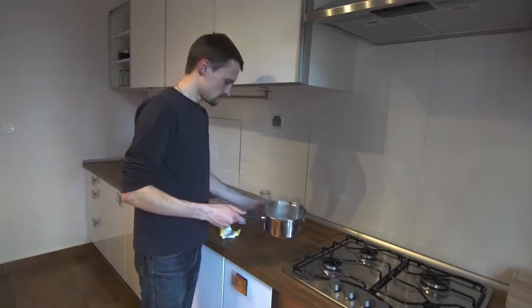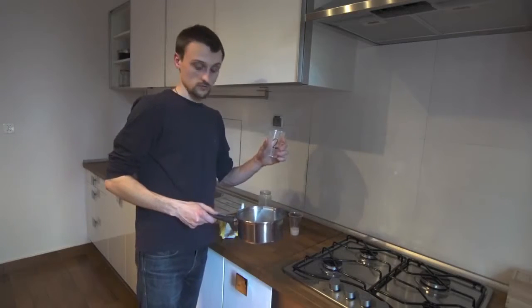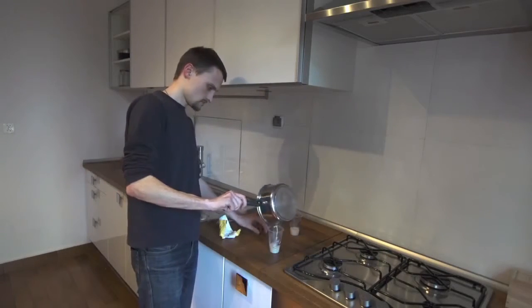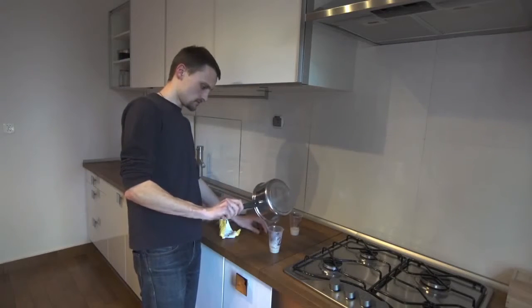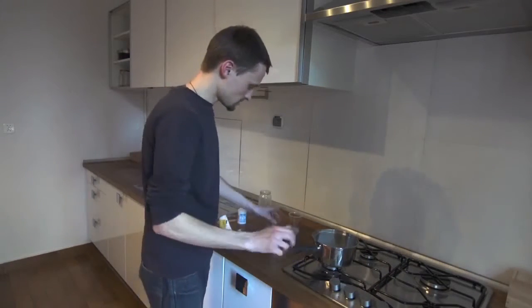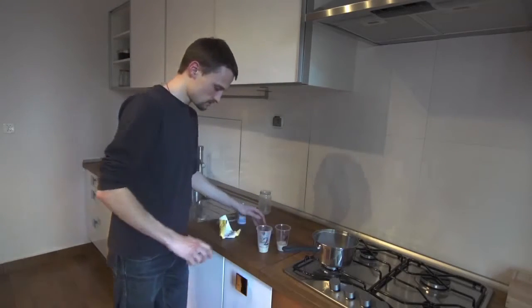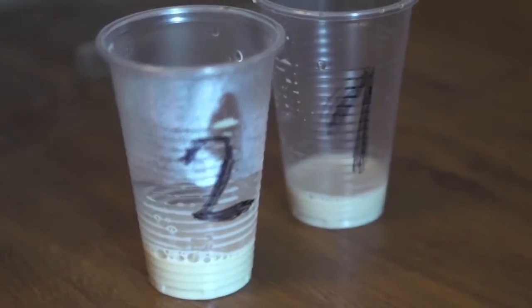We pour the mixture into the vessel labeled 2, taking care because it is very hot. In this way we have obtained yeast which produces bubbles and yeast which does not produce bubbles.